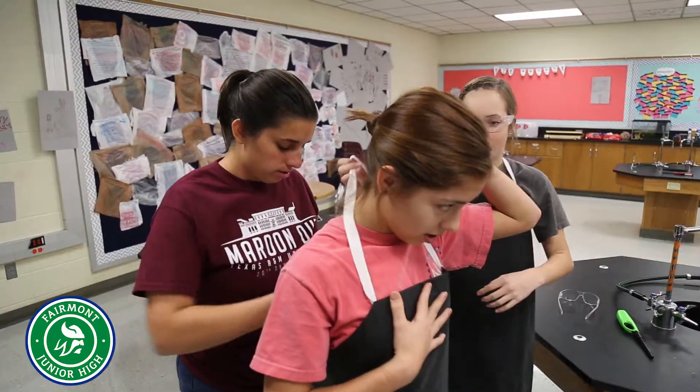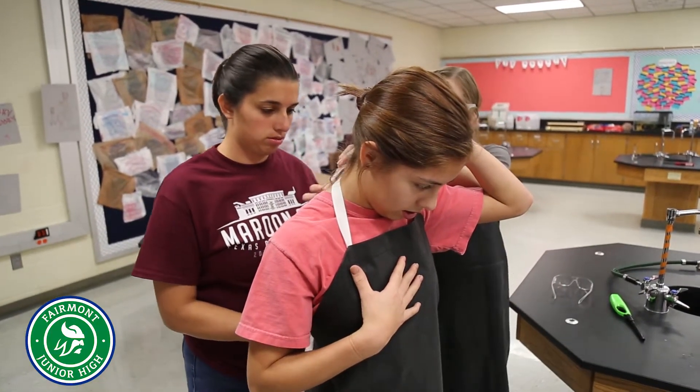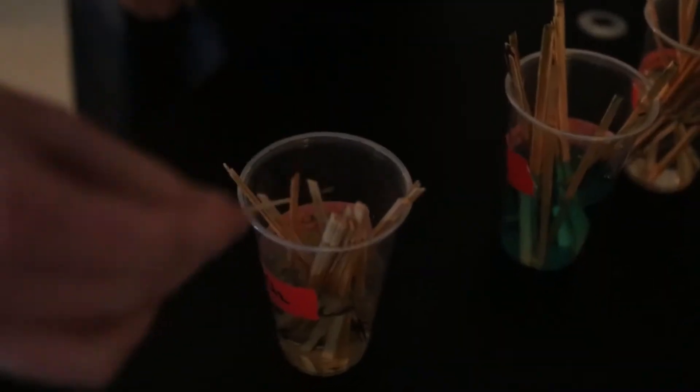Today in class they're doing a flame test, testing different salts to see their reaction when inserted into the flame. For all these sticks, they're soaked in a salt solution right now, and each of these salts has a different electron configuration.